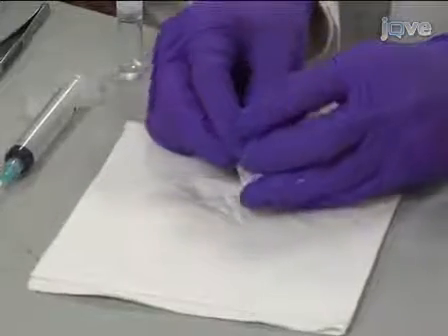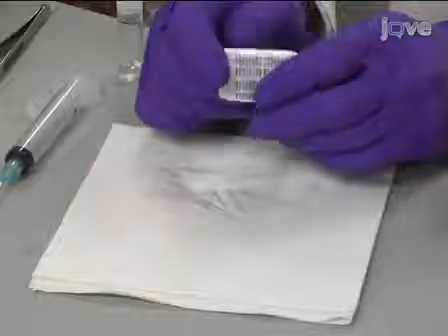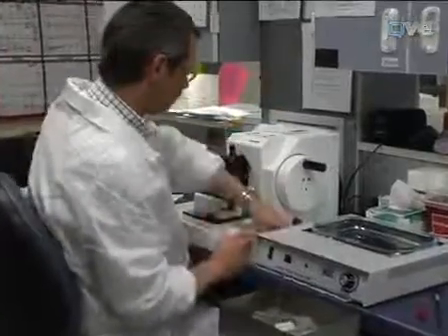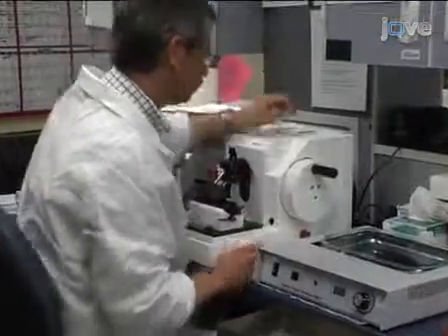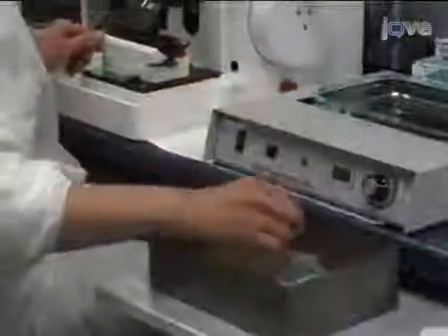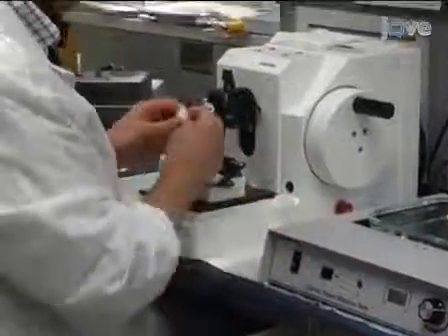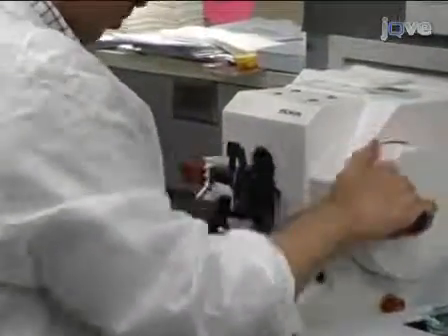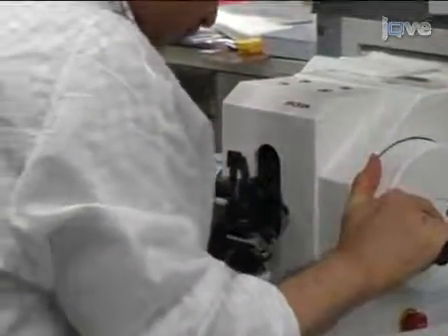Once the cell block is embedded, proceed to cutting the specimen. To start cutting the disk of the cell block embedded in paraffin, mount the paraffin embedded cell block on the microtome. Section by coarse cutting for leveling the surface of the paraffin block and exposing the disk of the cell block until the dark colored AV marker is exposed and clearly visible.